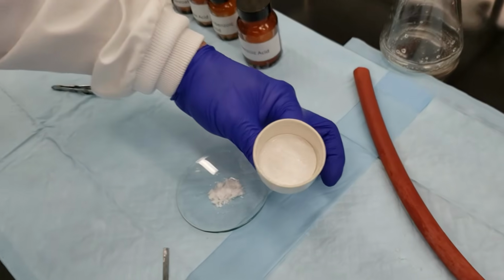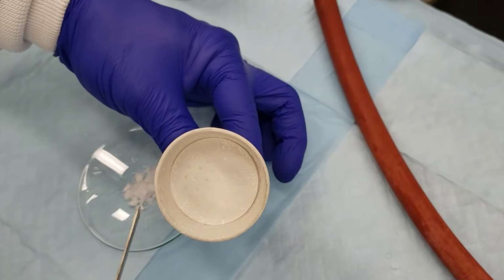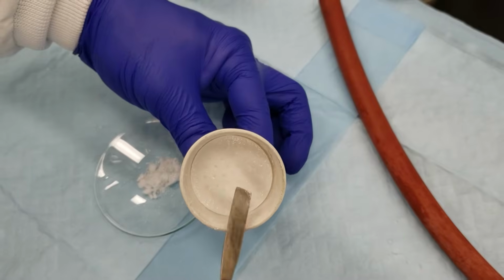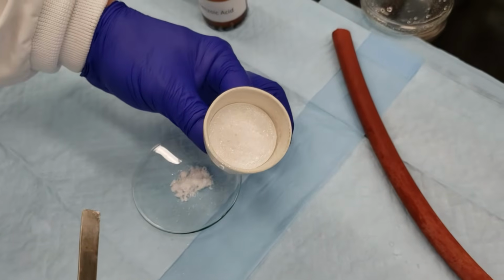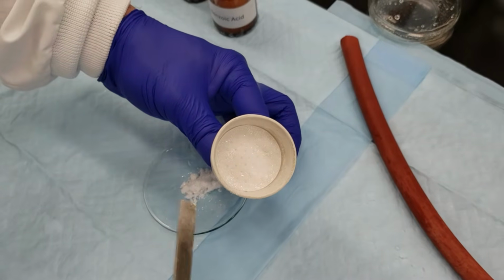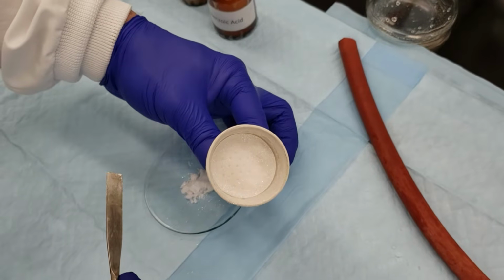All right, so there's a small skin of crystals. We've got some dampness. We still have a little bit of water in there, even though we've been pulling through air for a while. So there's going to be some crystal loss as a result of the filtration process. That again will factor into our percent recovery. When you're looking at possible sources of lost crystal weight, this is one of those.